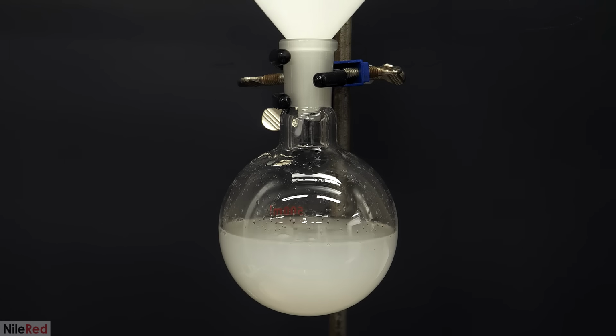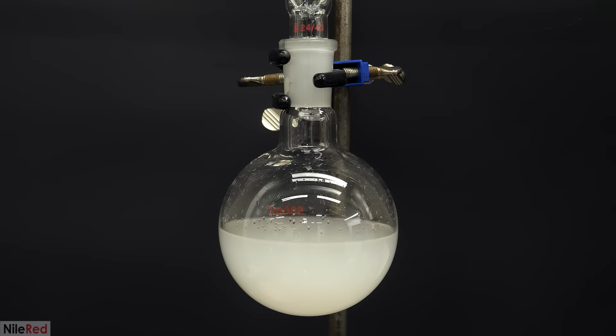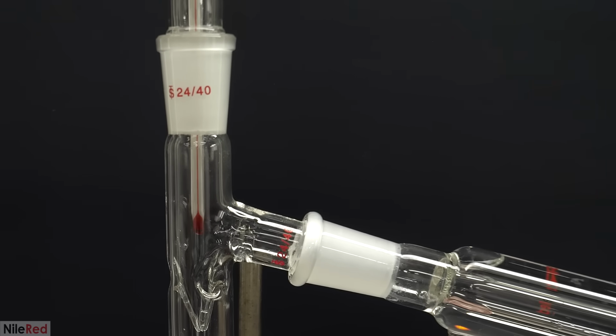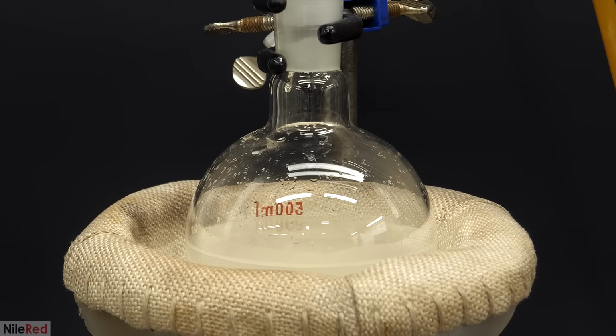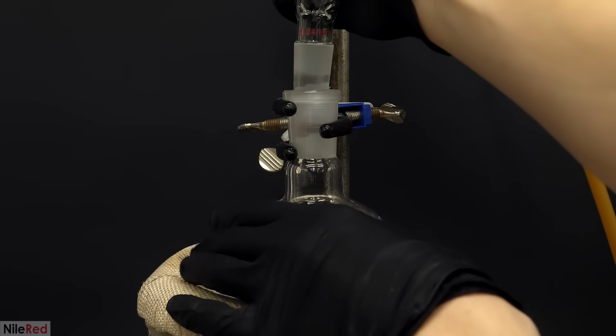This time, I had a lot less liquid, so I could do it in a smaller flask, and all in one batch. I also completely cleaned and scrubbed the rest of the setup to make sure that it was as clean as possible. I then set it up like before, but this time, the heating mantle was a bit oversized. This was okay though, and it would just make the heating a bit less efficient. However, with most of the yeast and most of the other stuff gone now, there shouldn't be a problem with bubbling or foaming.